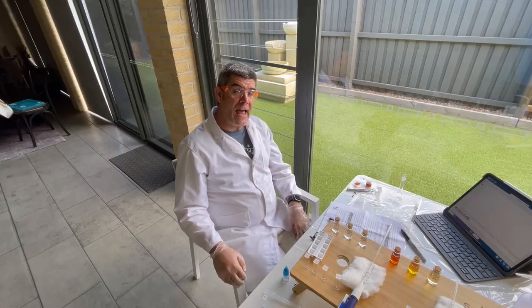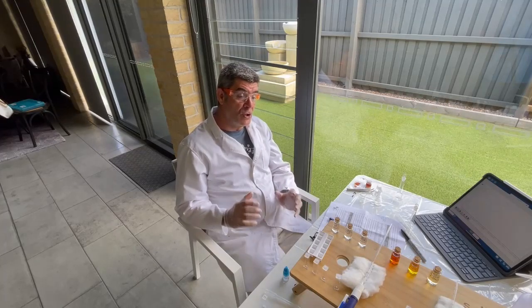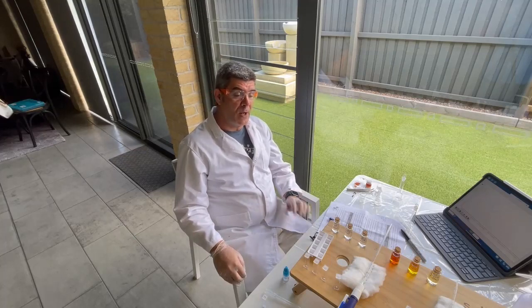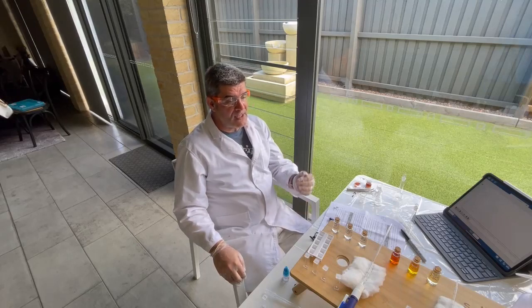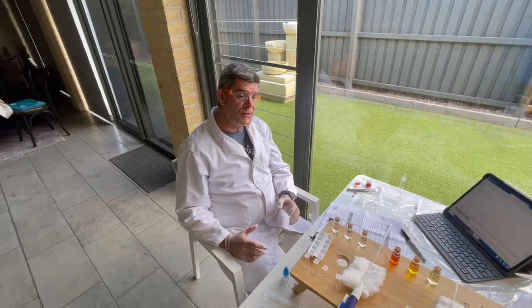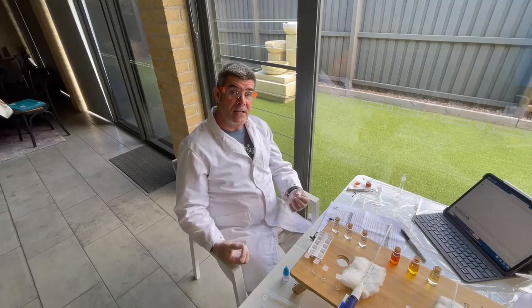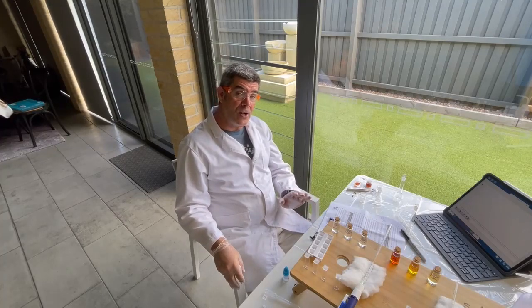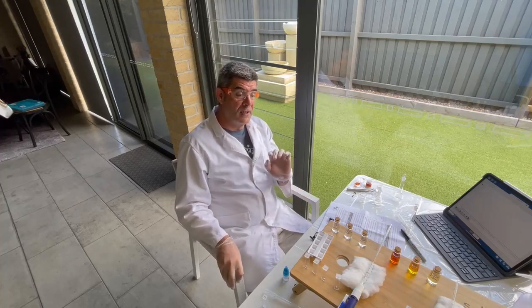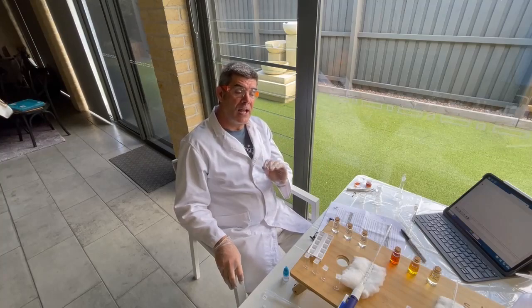Today we're going to have a look at both colorimetry and also a way of quantitatively calculating an equilibrium constant. We're going to use chemicals we've used previously, and we're going to recreate the iron thiocyanate equilibrium, and see if we can create some different solutions, measure their absorbance with different wavelengths of light, create a calibration curve or a line, and then see if we can create an unknown solution, and from the absorbance calculate its concentration, and then see if we can work out an equilibrium constant.